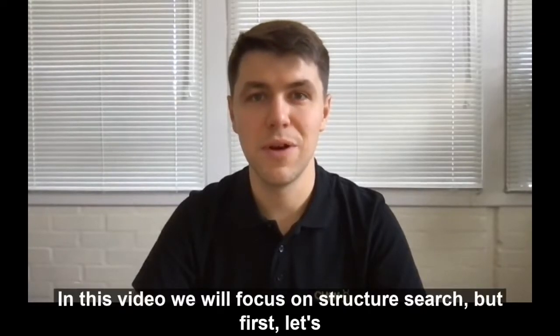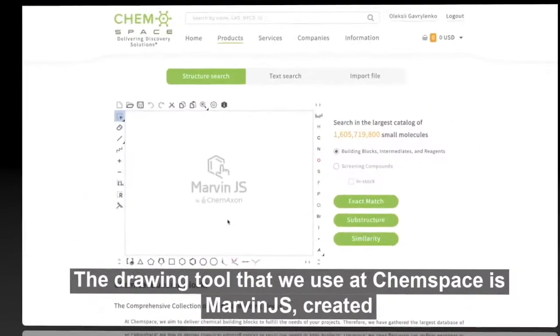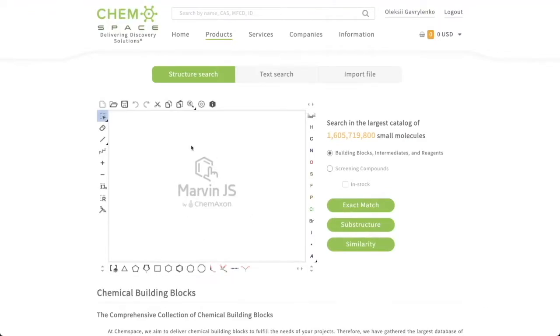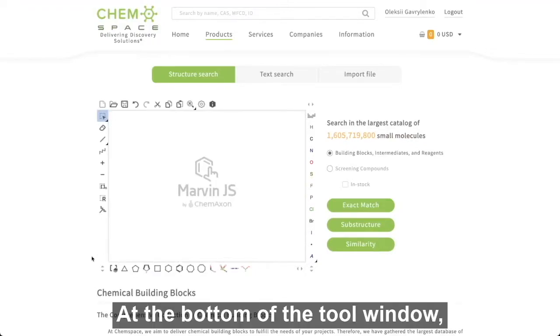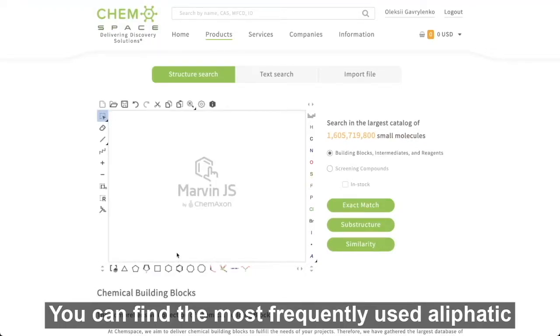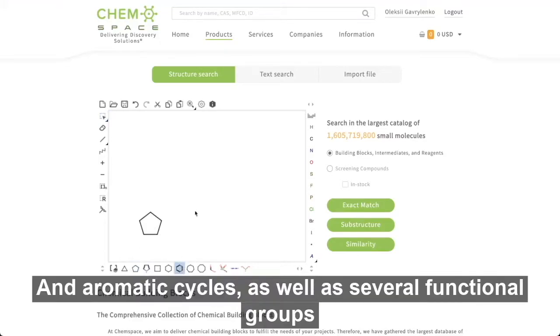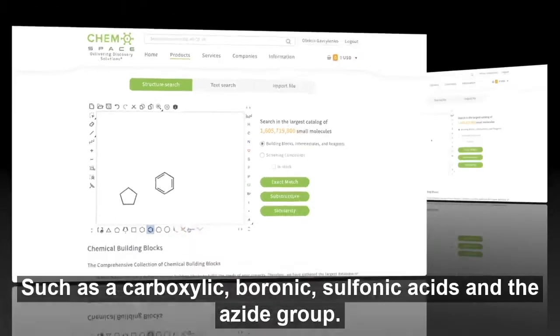Hello, in this video we will focus on structure search, but first let's take a quick overview of our chemical drawing tool. The drawing tool that we use at ChemSpace is Marvin.js, created by Chemaxon. A few words about the main frames and functions. At the bottom of the tool window you can find the most frequently used aliphatic and aromatic cycles, as well as several functional groups such as carboxylic, boronic, sulfonic acids, and the azide group.